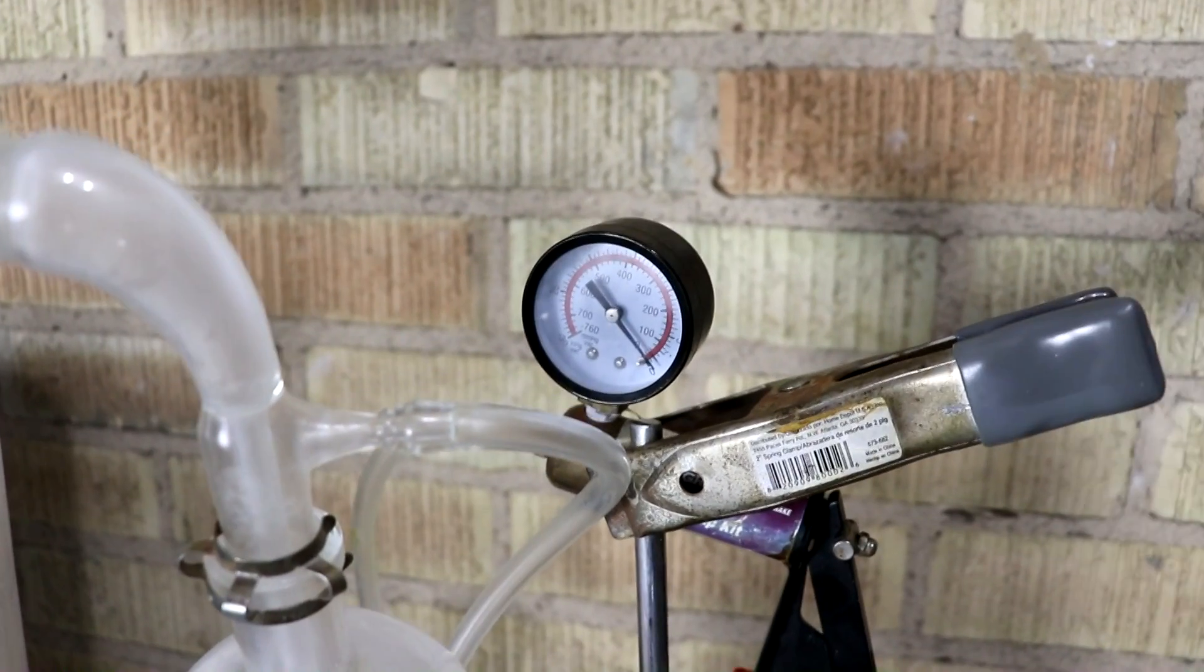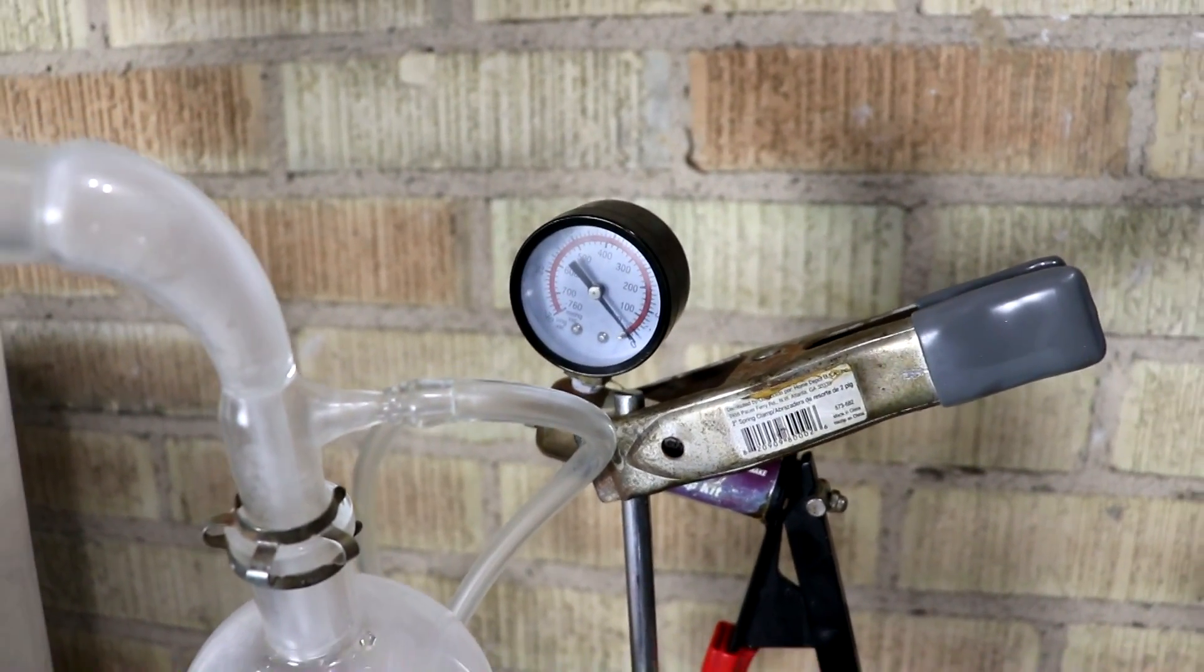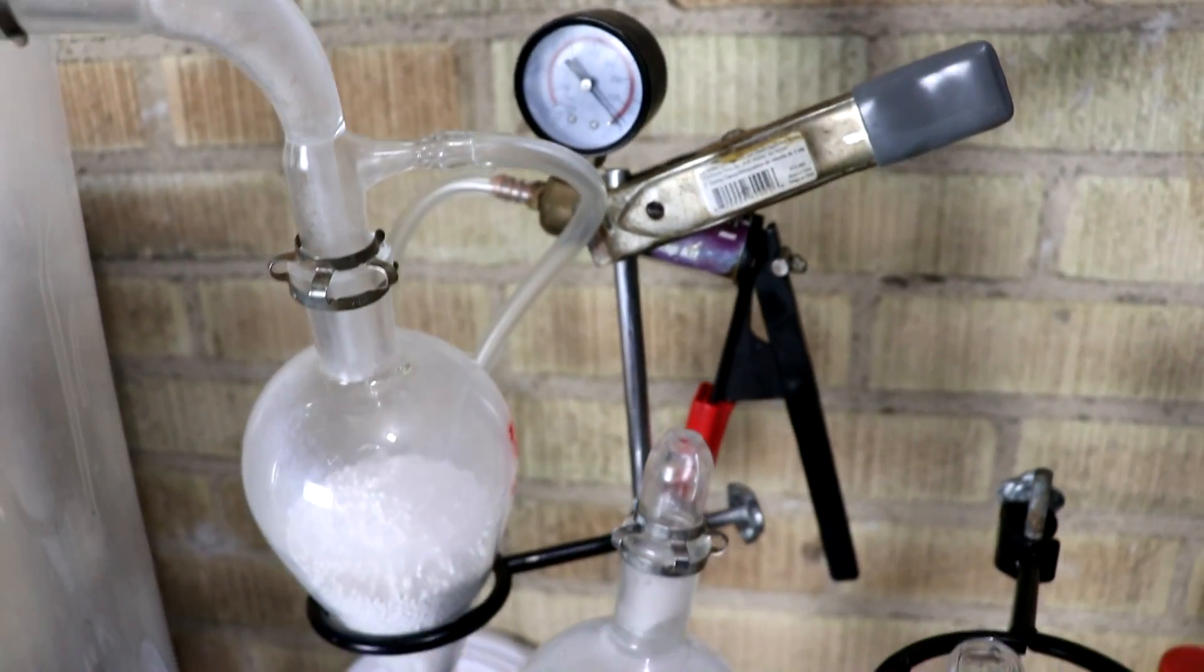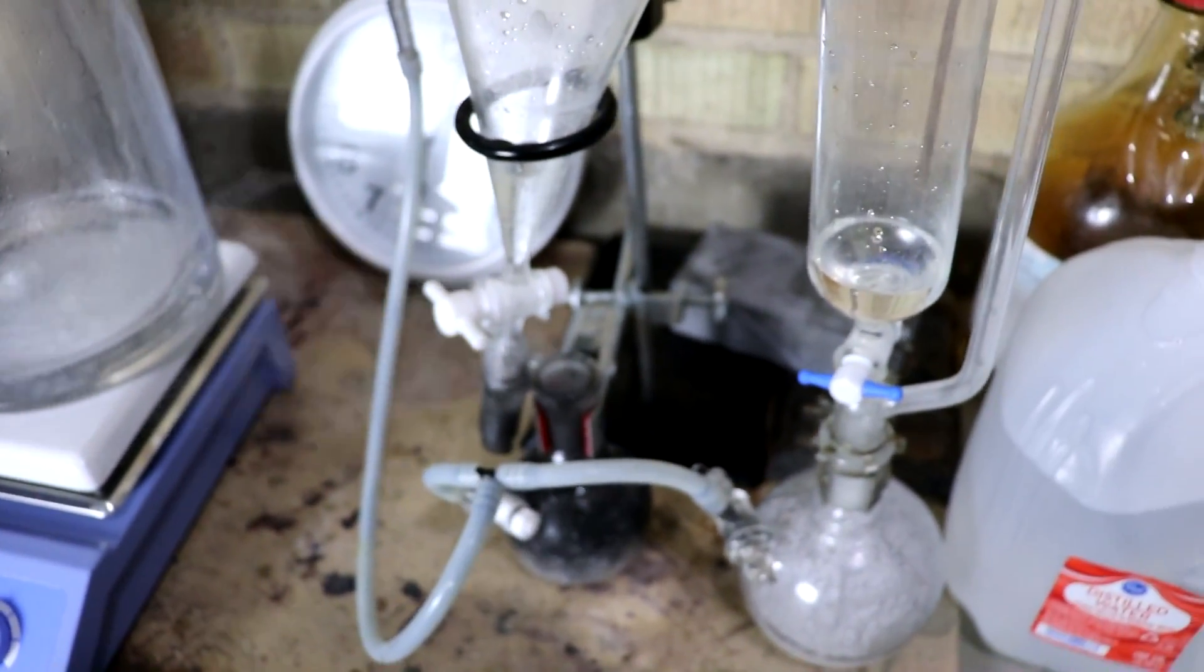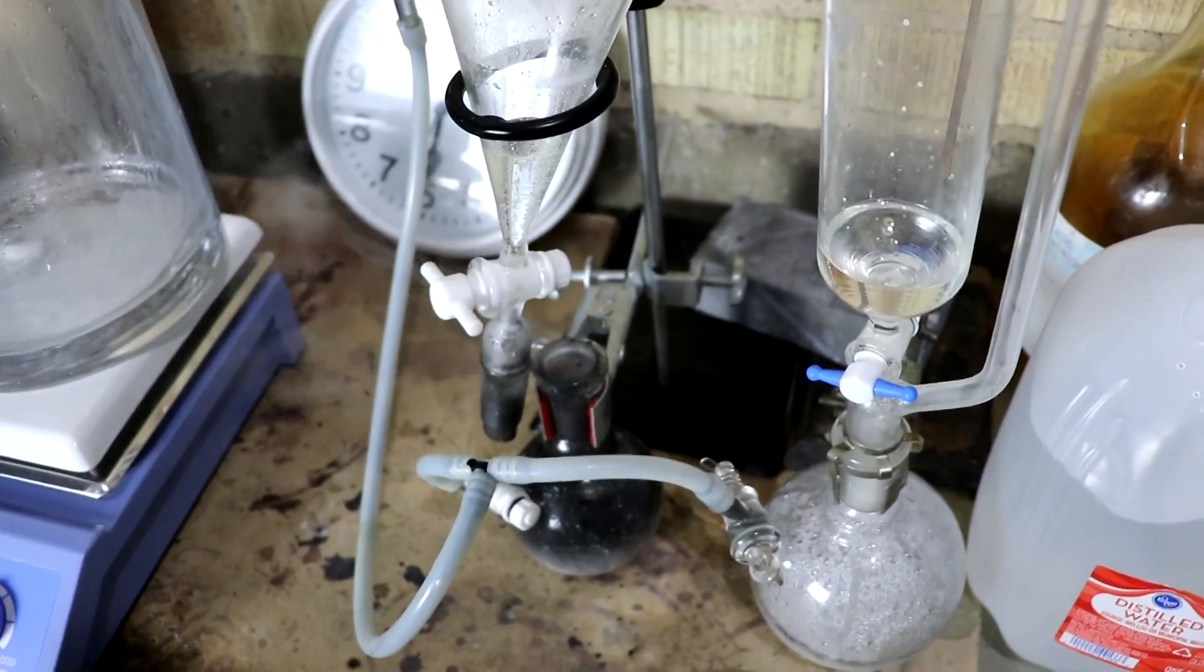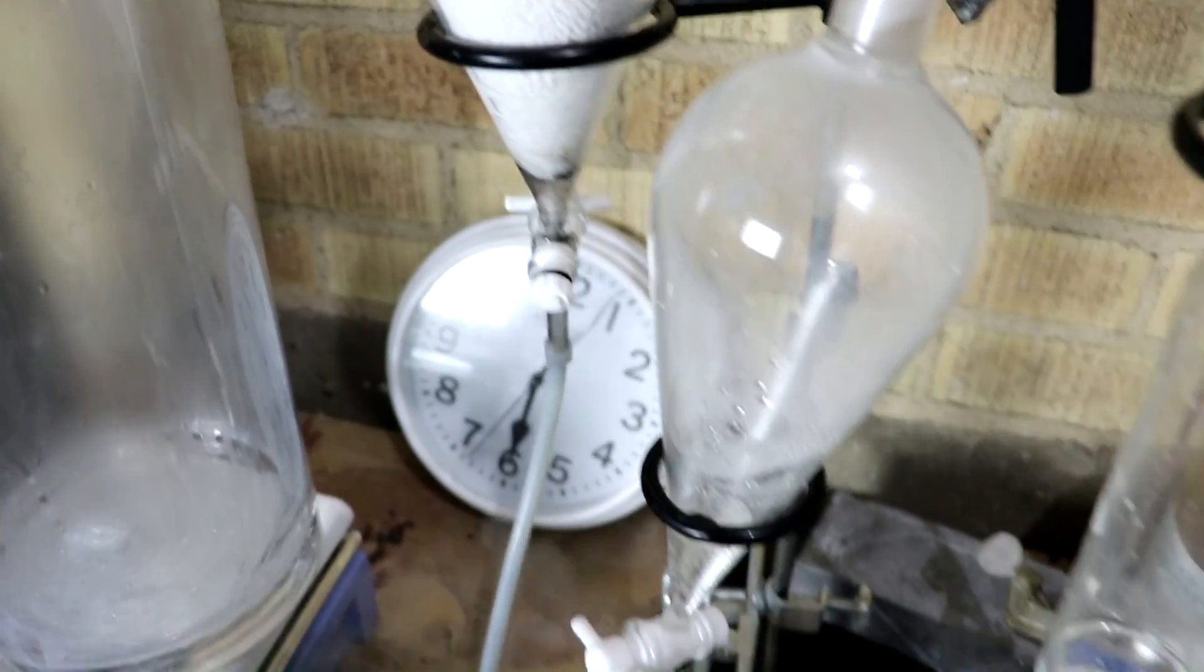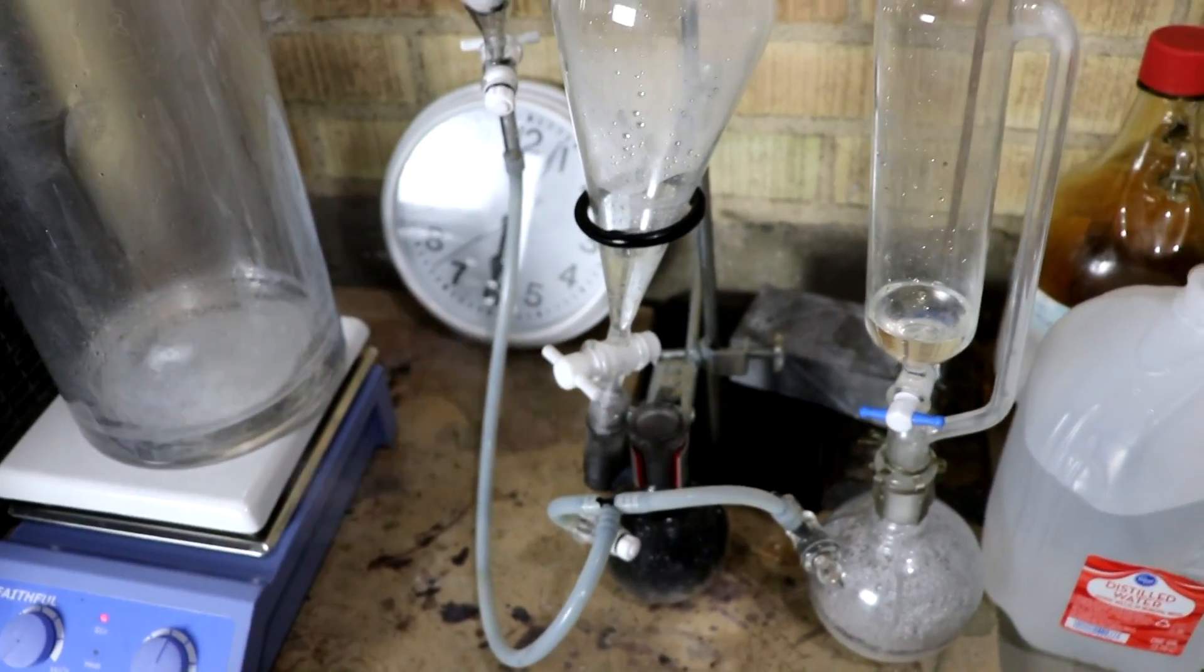Since I had an excess of sulfur dioxide, I decided to put some more oxygen in and bring it up to normal atmospheric pressure. Of course, I overshot on the amount of peroxide, so I've had to release it. Fortunately, I was able to shut it off right here and just let the oxygen go off into the air.